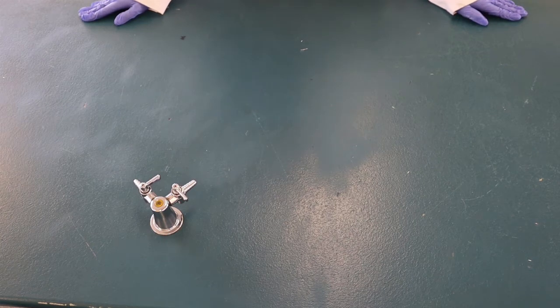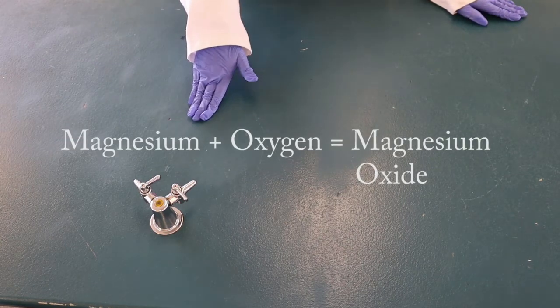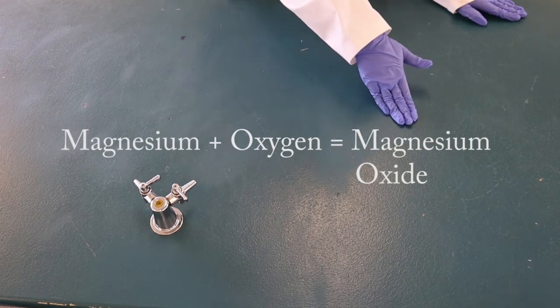In this experiment we will carry out the following reaction: magnesium plus oxygen equals magnesium oxide.